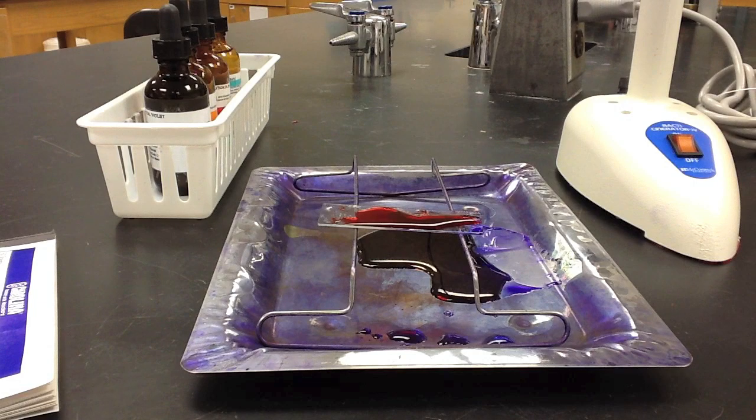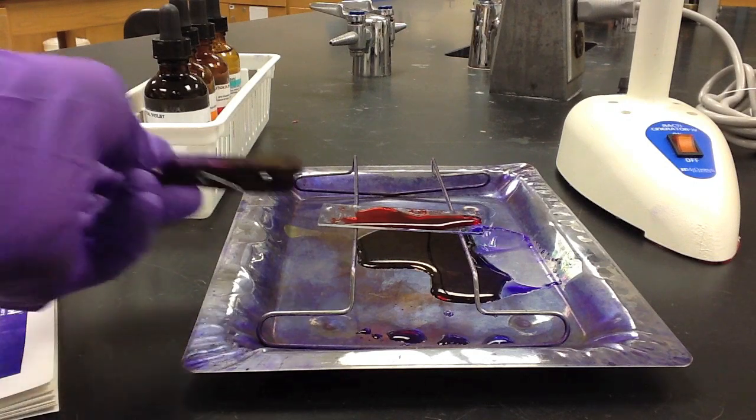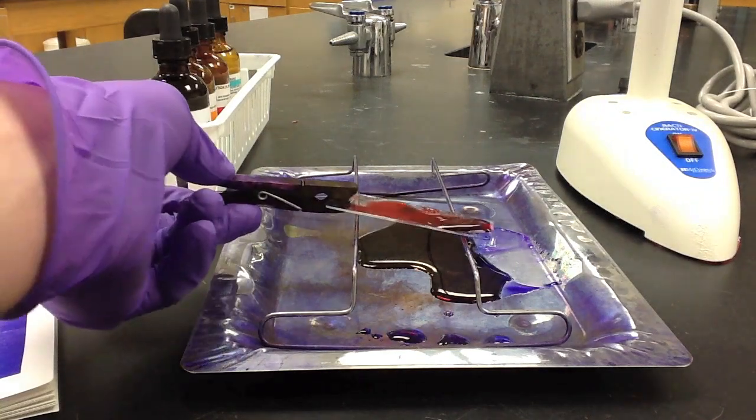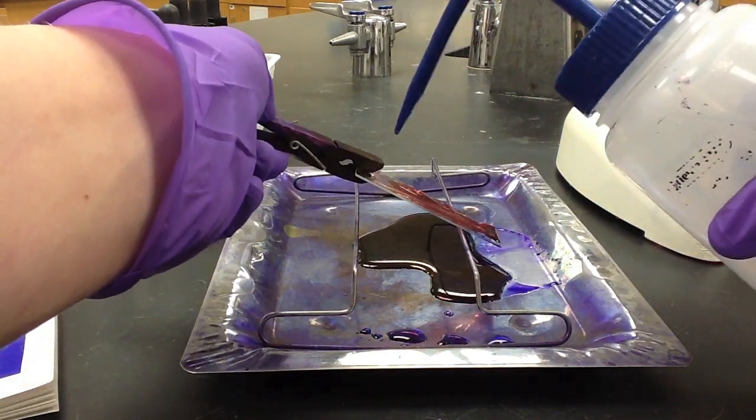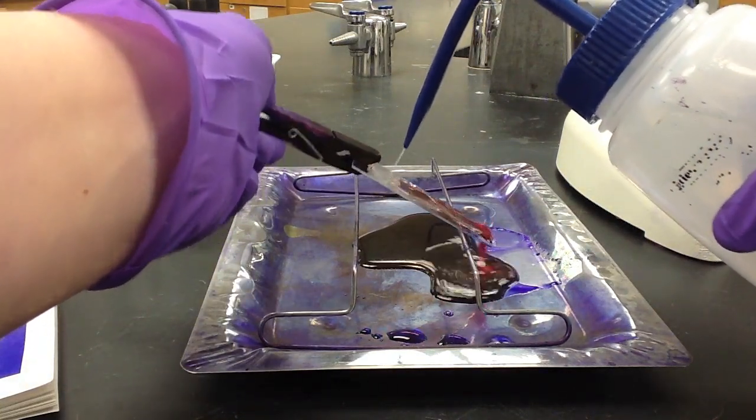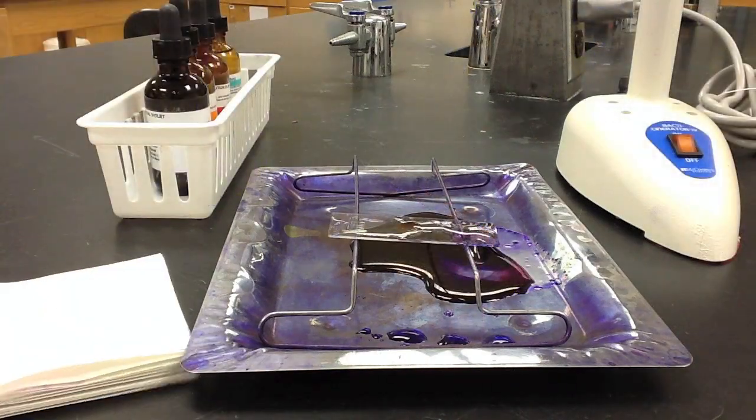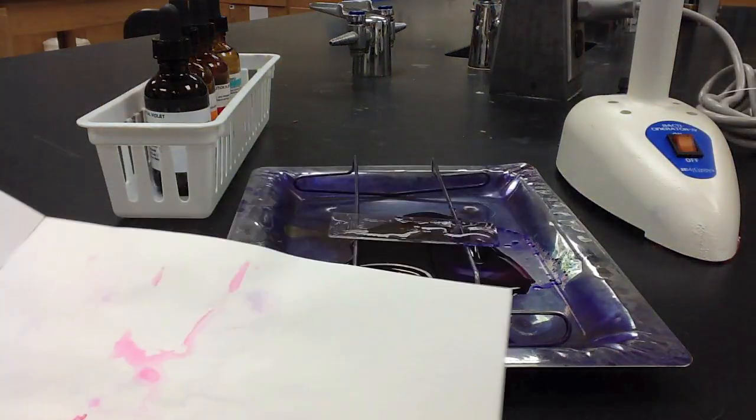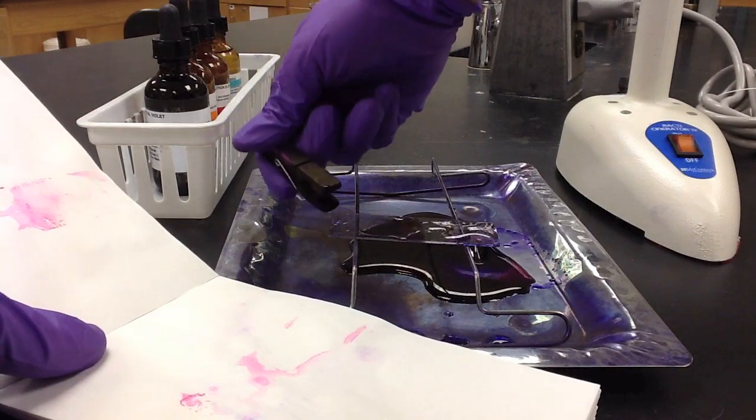At the end of the incubation period, we'll rinse off the safranin using deionized water. Once we've fully rinsed off the safranin, we'll then place the slide into a booklet of bibulous paper and gently pat it to dry it.